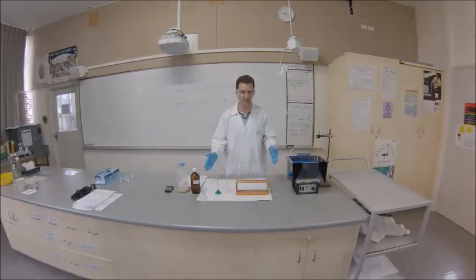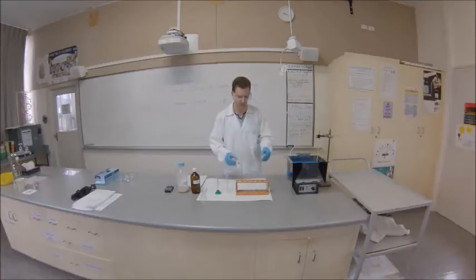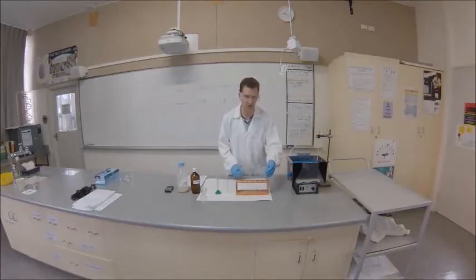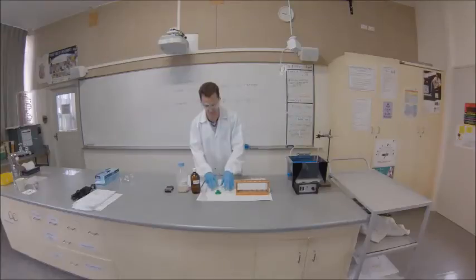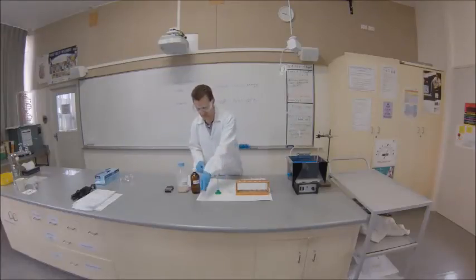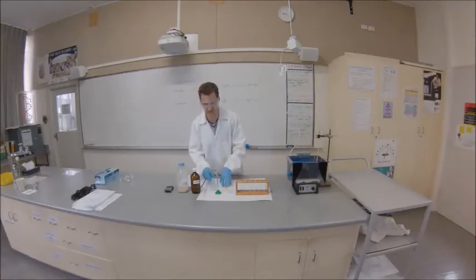In terms of equipment, we have a few different pieces here. We've got large test tubes for containing our solutions and collecting CO2. We've got 10ml measuring cylinders and a funnel to prevent any spills.